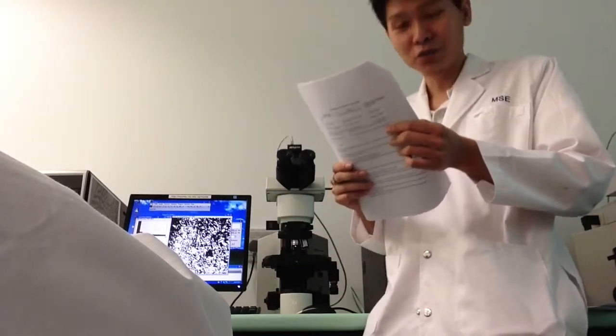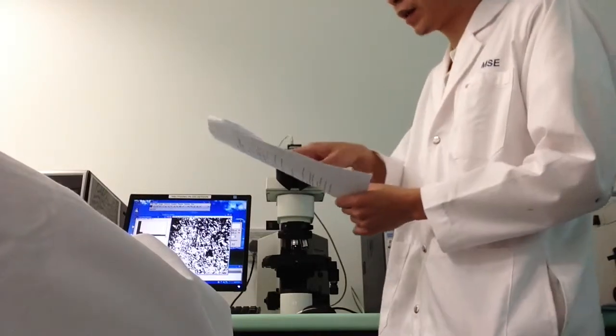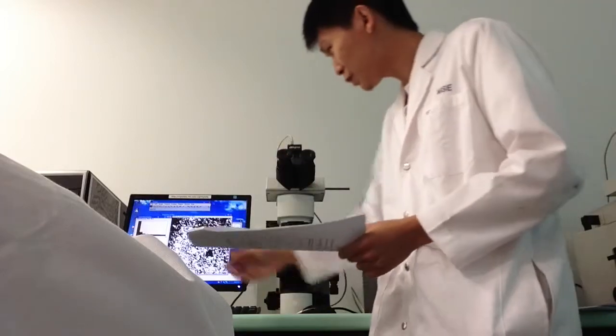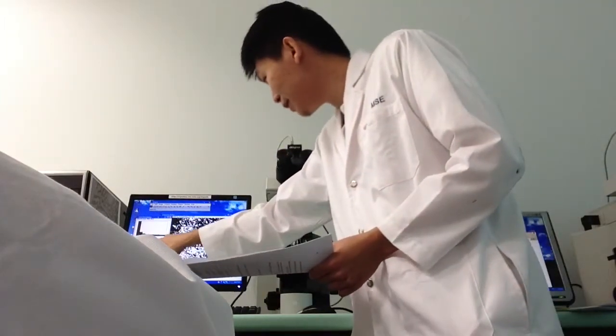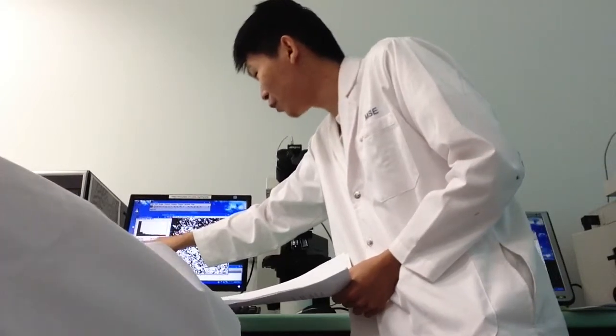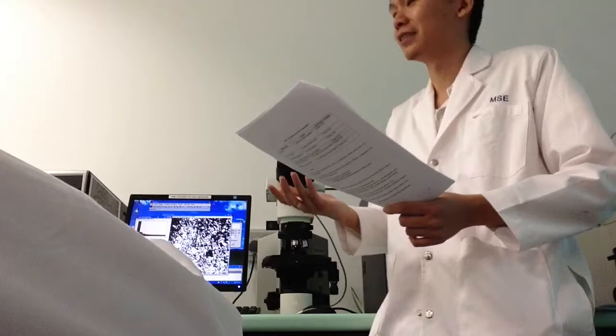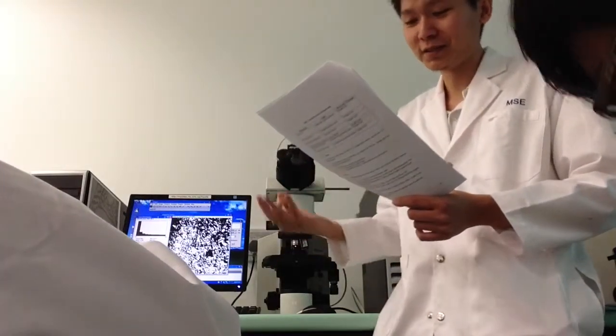And for question number 3, compute the average grain size and bracket mean, right? If you look carefully, there's a mean computed value already over here also. So you just cut and paste. It's like 4.169 for this case. So you just throw in the data. So number 3 is done again.